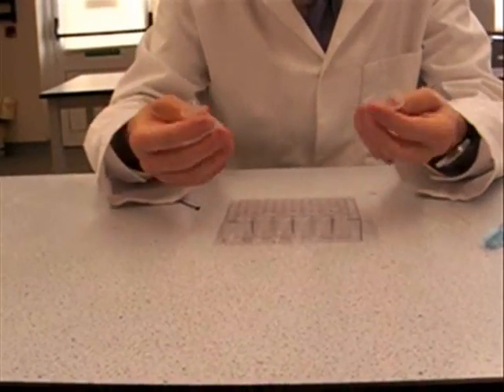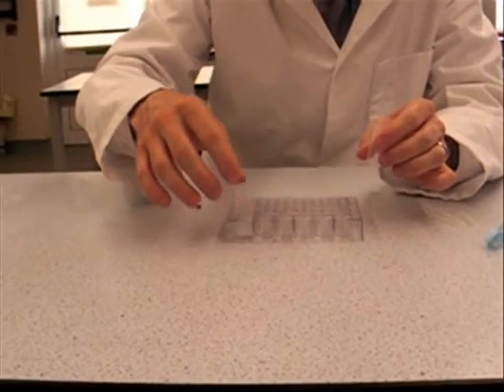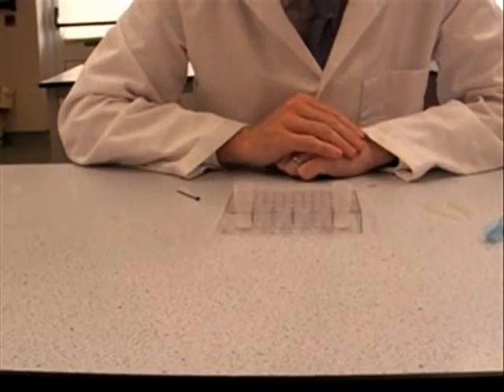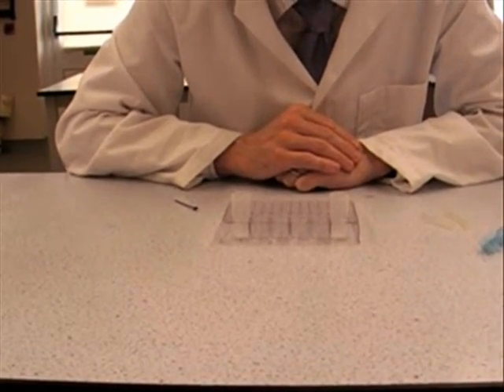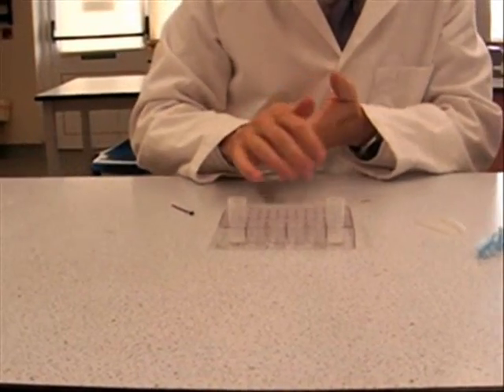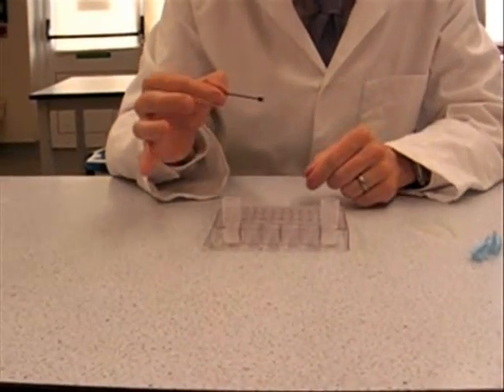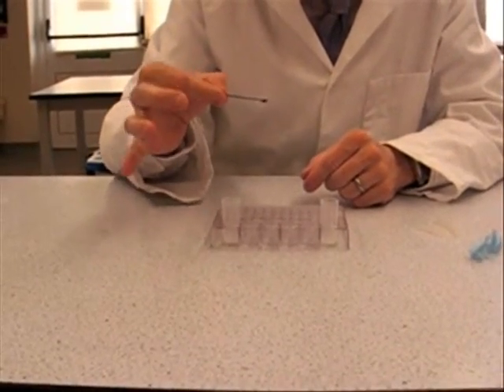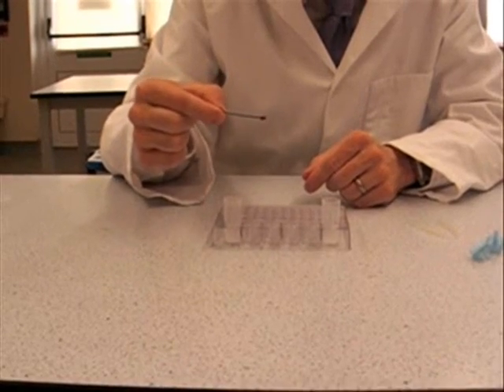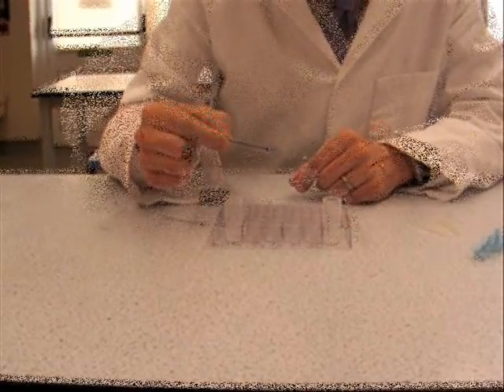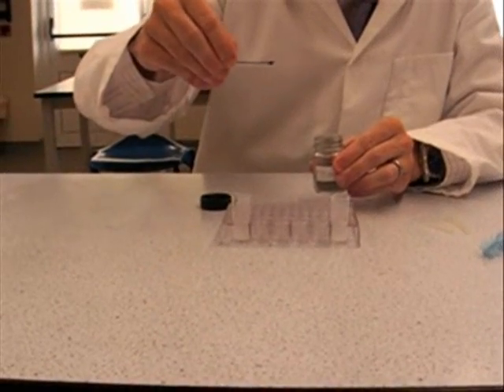Next thing we need to do is get your two reacting vessels I guess and pop them into F1 and F6 of your combo plate. And then comes the fun bit, it's measuring out the absolute tiny amounts of chemicals.